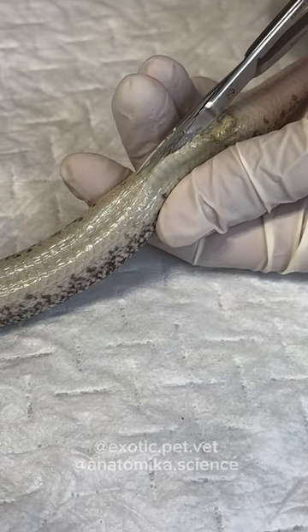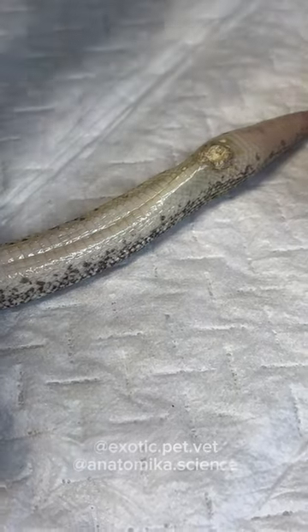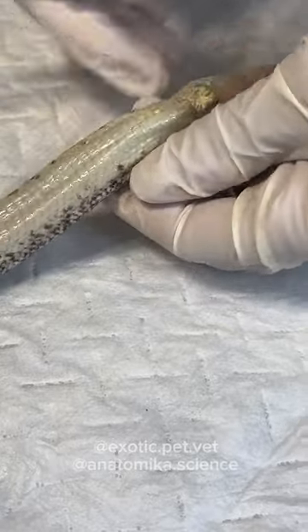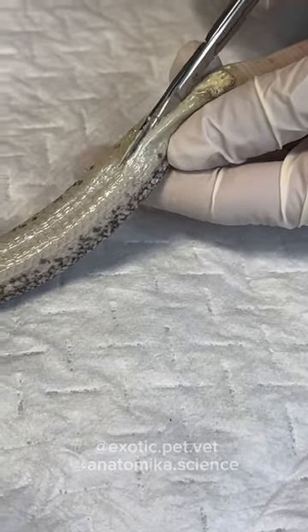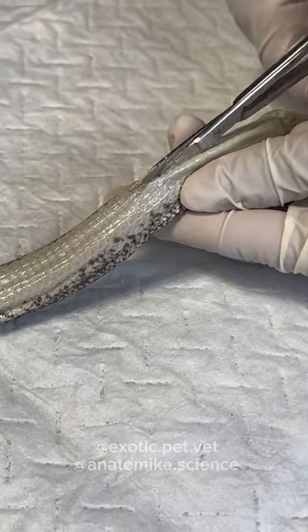A lot of times when I see people do their home necropsies, they'll use a box cutter or something and it cuts right through the heart. Exactly — and then they'll leave this gigantic cut on all the organs and everything's so bloody and gross. Gotta keep it clean.